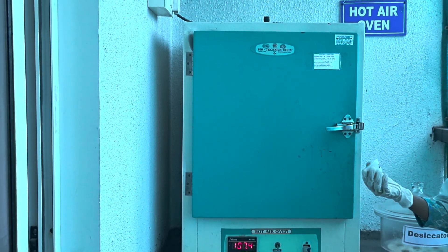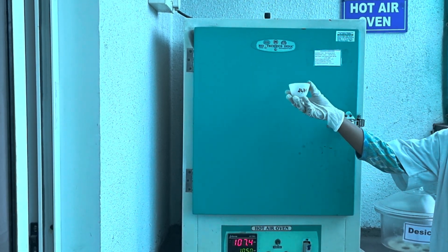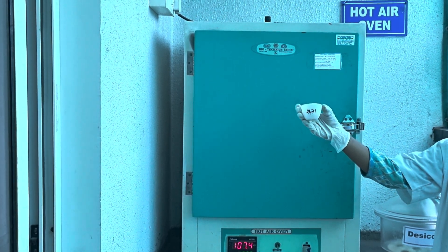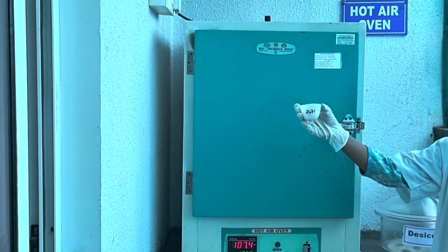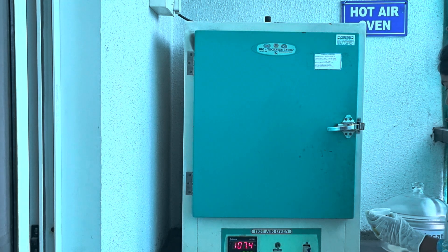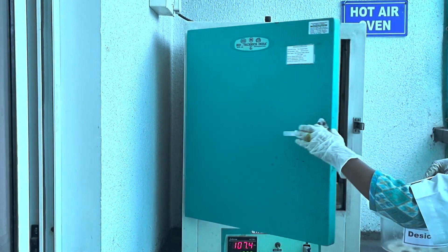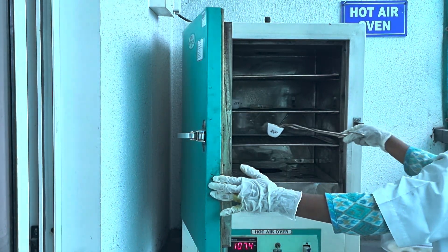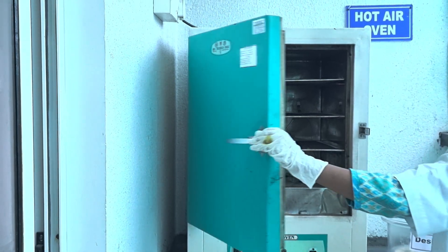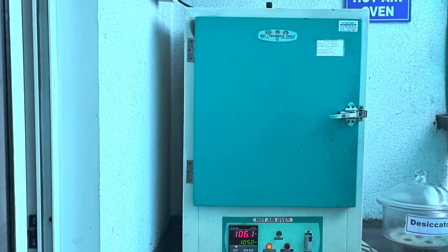Now we will see the practical demonstration for ash content. This is the silica crucible in which we will carry out the ash content. For this, we have to condition this crucible in an oven. We will keep this silica crucible in the oven for at least 15 to 20 minutes for conditioning purpose. After that, we will take its initial weight.